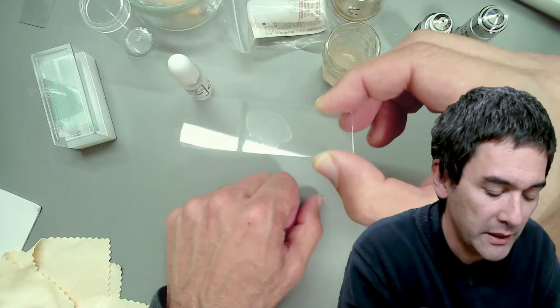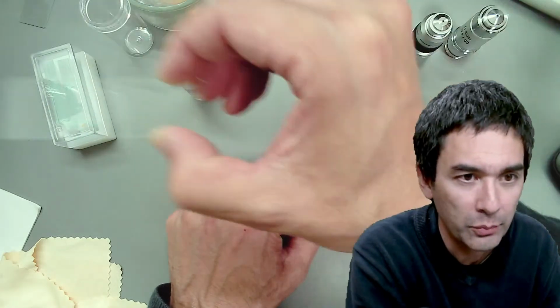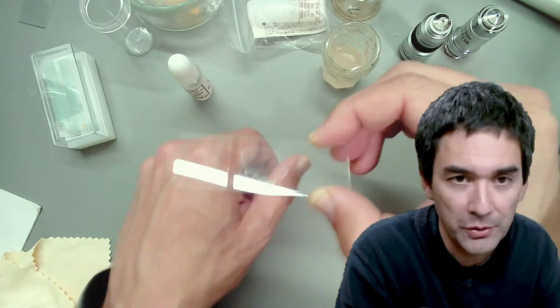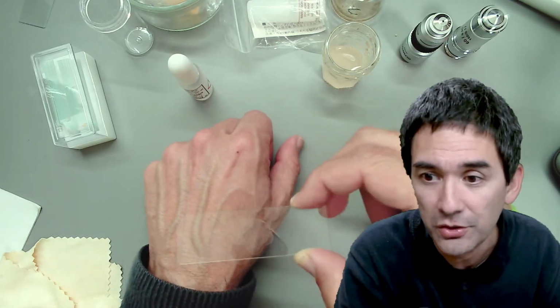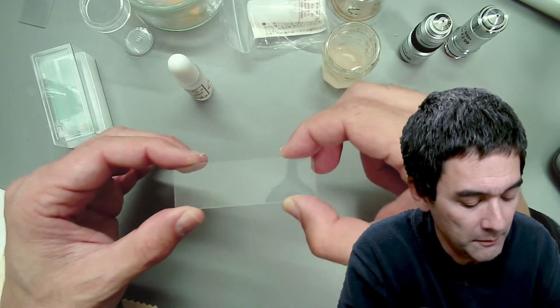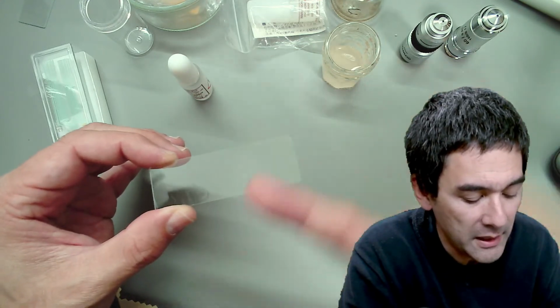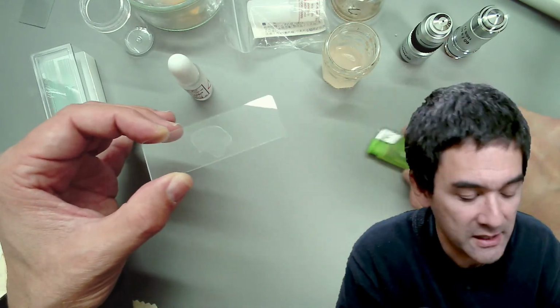When I've been doing this, I knew exactly how fast I had to pull it through the flame 2 times, and then I always got it right. And then you could place it here. It was very hot, but it didn't hurt you. Okay, so this is number 1, and then what I'm going to do is heat it using a lighter, because I don't have a gas Bunsen burner.